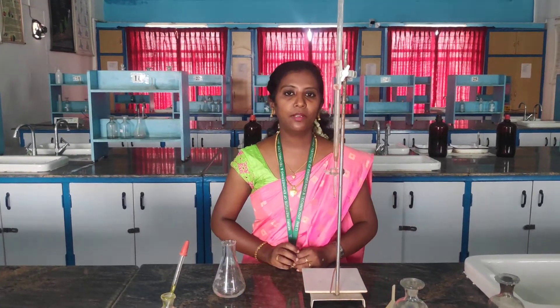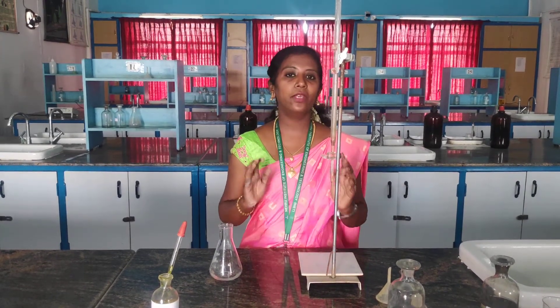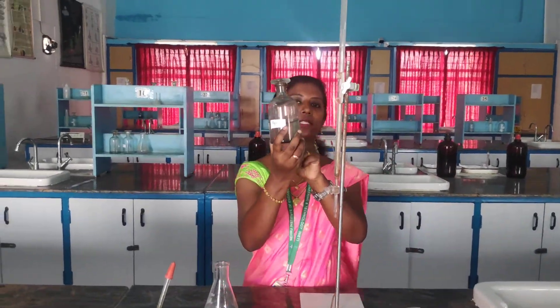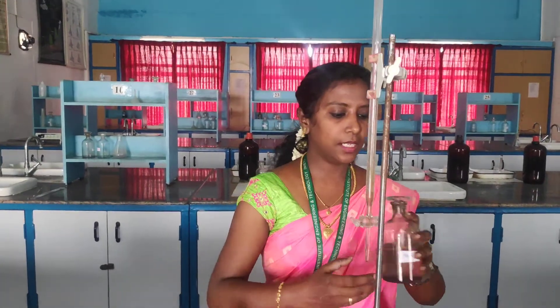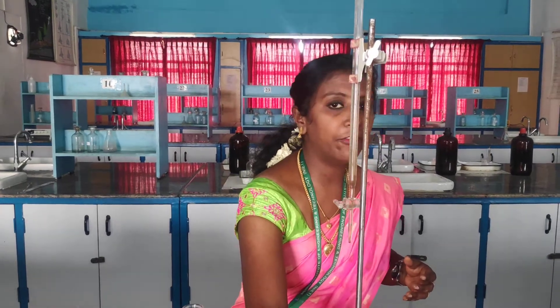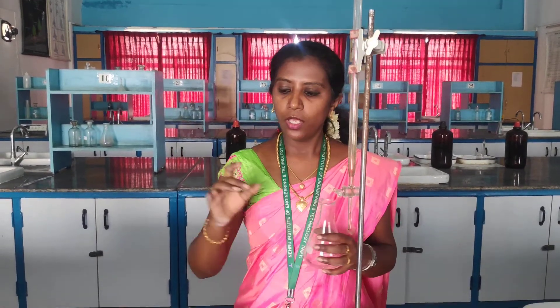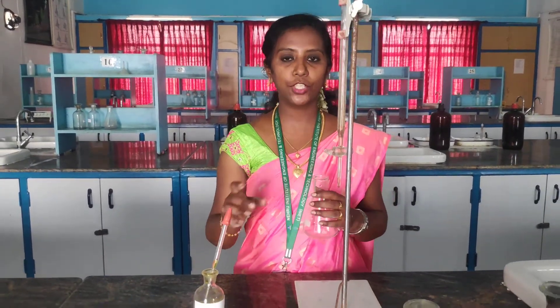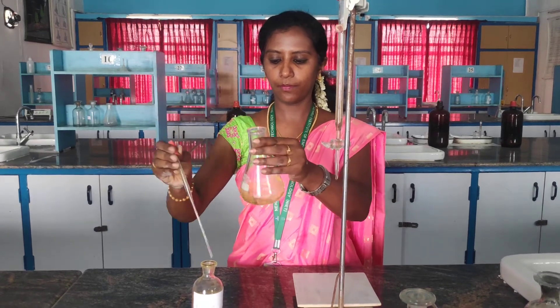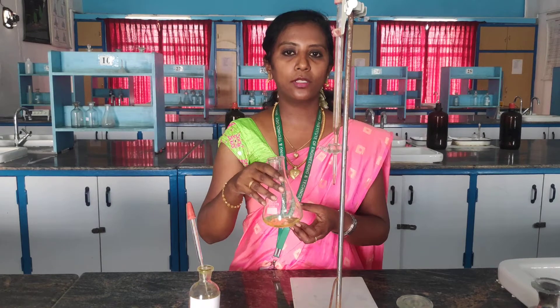Practically we are going to see how the chloride ions are removed from the water sample. For this, I am going to take silver nitrate as the burette solution. You can see silver nitrate which is taken as the burette solution, and next I am going to take sodium chloride as the water sample — the water which contains chloride ions. Already I have filled the burette with the silver nitrate solution and I have taken sodium chloride in my conical flask. In the first step, we are going to add an indicator which is potassium chromate. Now I am going to add the indicator, potassium chromate. I have added potassium chromate and now I am going to titrate this water sample with the burette solution. Let us see what end point we are going to reach.